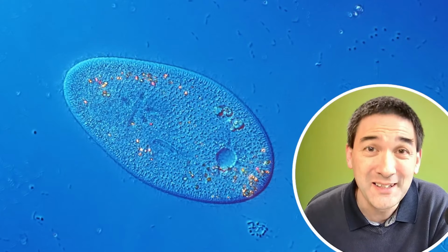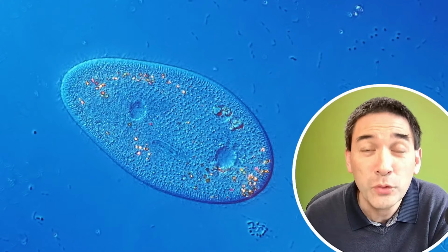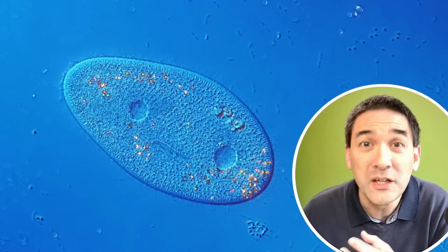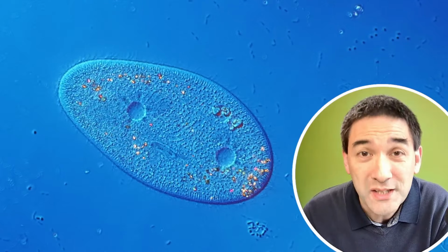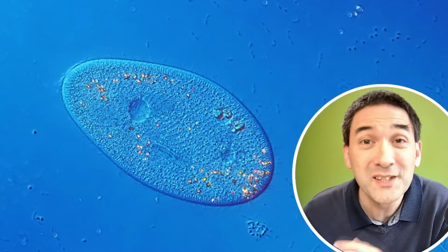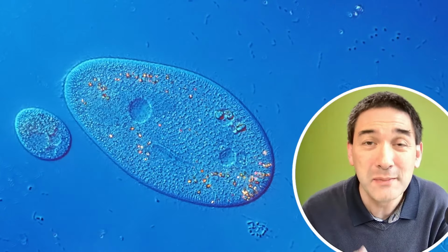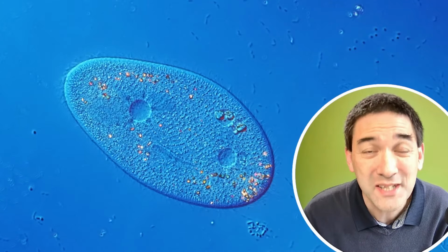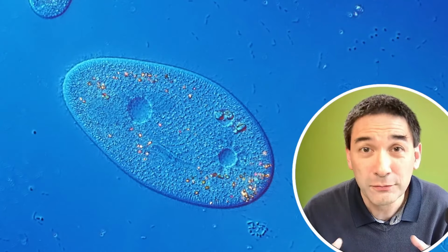Well, that is the whole point of this video, because it always has water moving into the cell. Those Paramecia, like many other cells, continually take up water because water flows into the cell by osmosis. And actually, this should cause the cell to burst and to pop open. However, this doesn't happen. So evidently, the Paramecium has some kind of mechanism in place to prevent it from bursting. And as a matter of fact, we can actually see quite well under the microscope what it is able to do to prevent it from bursting.